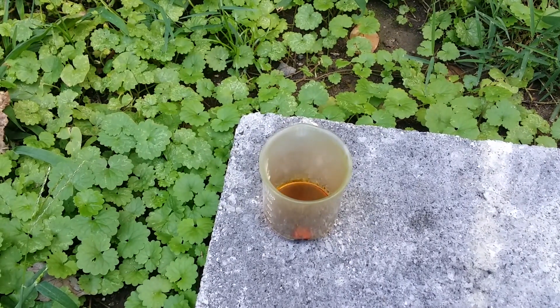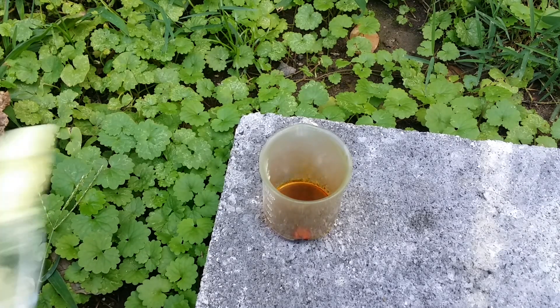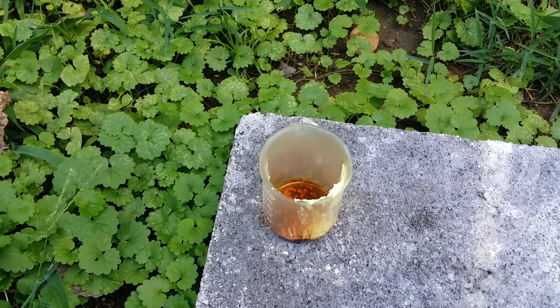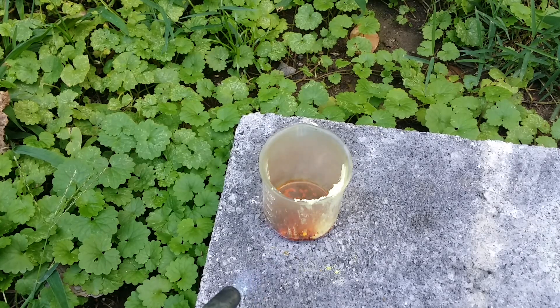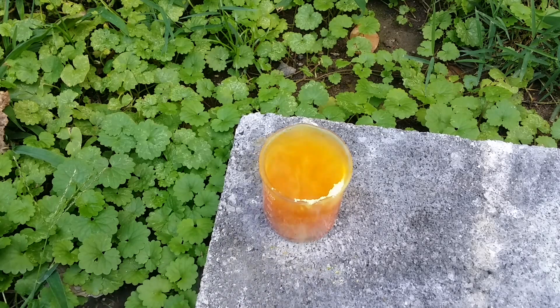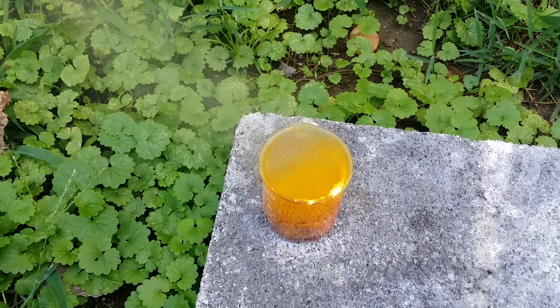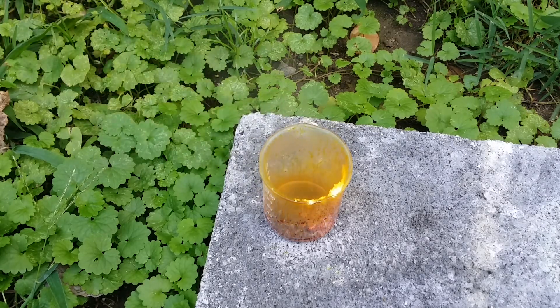So now let's try a bit of sulfur. Let's heat things up a little bit to get it going. The orange substance I see here — I believe that's disulfur dibromide. Not very pleasant stuff at all — I'm very glad I have this respirator on. Most of the sulfur is gone now and it has been oxidized.